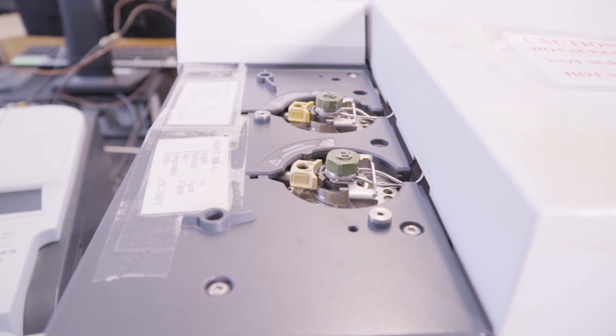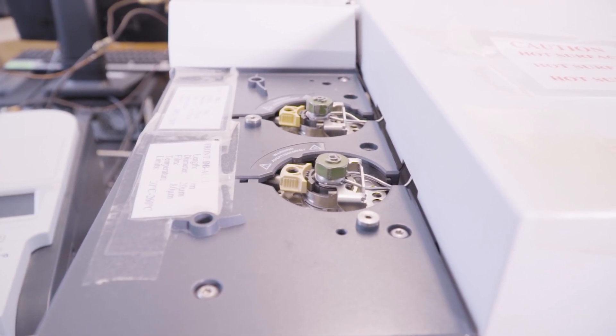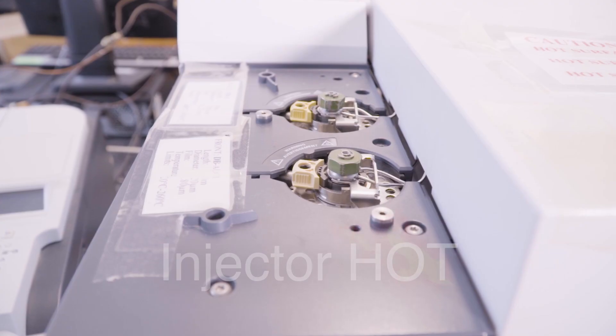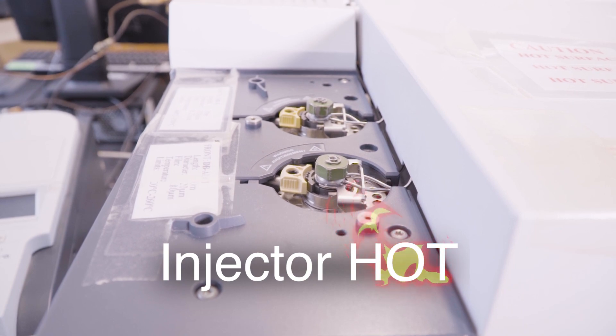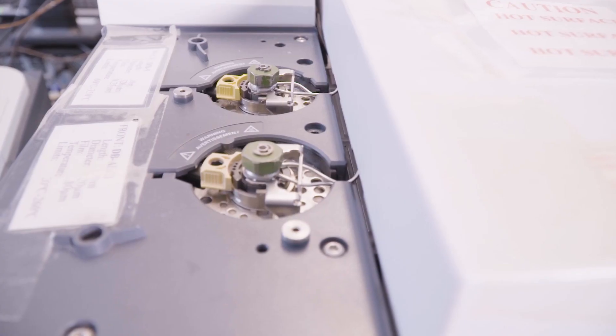Now let's take a closer look at the injector. This is where we introduce our sample to the GC. The sample, in liquid form, is vaporized to gas in the heated injector. Please note that the injector can get hot during the injection process, so be cautious and avoid touching it.